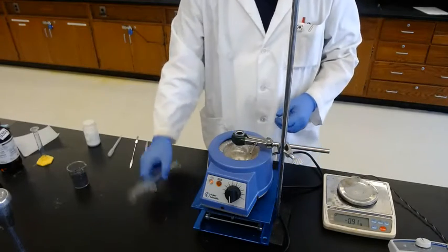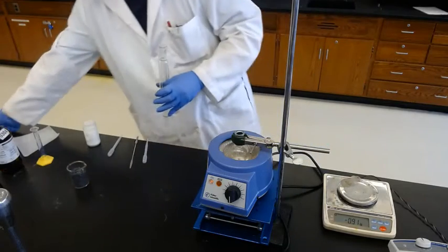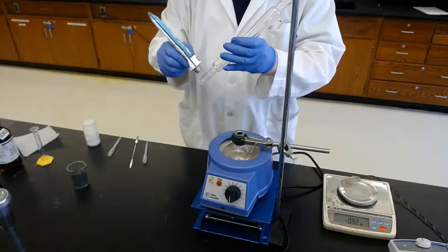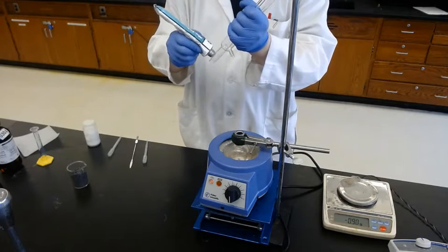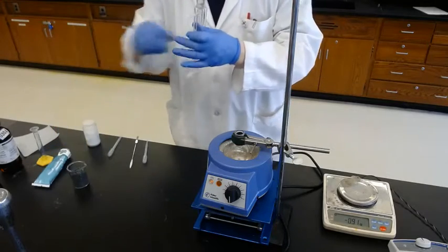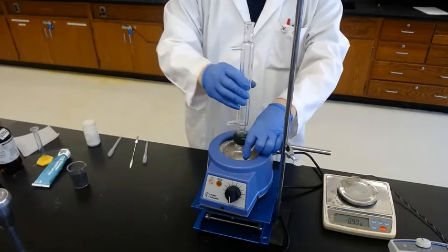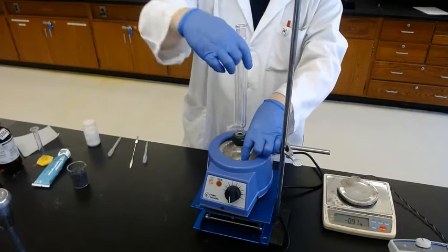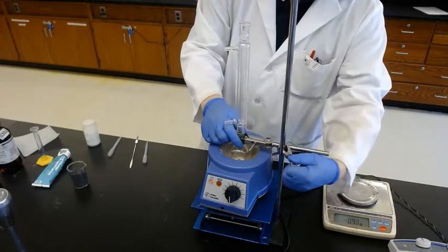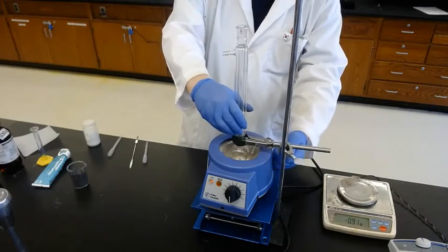And for the reflux, I've attached the condenser. Reflux condenser. With the grease, as I said, we don't need a lot because it's a headache. Just a little bit in 3 different places. Put it there and spin it. Make sure the grease is spreading. Then make it straight.